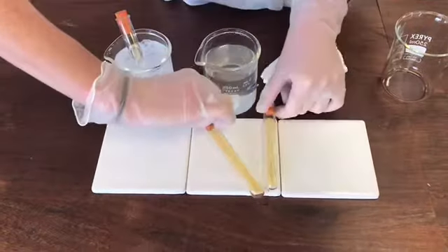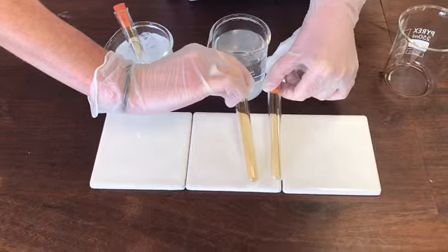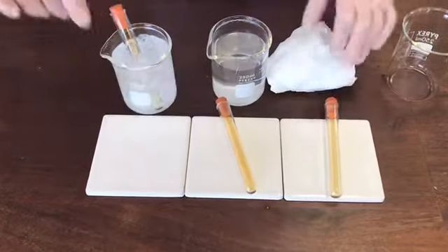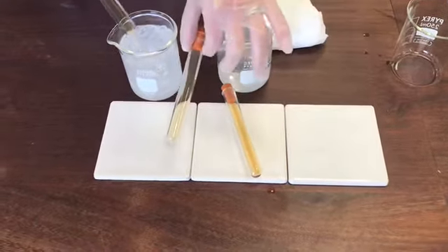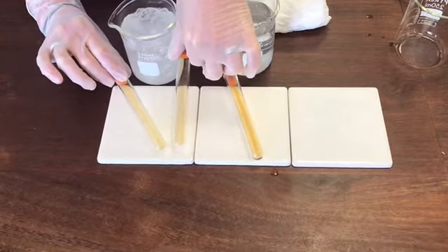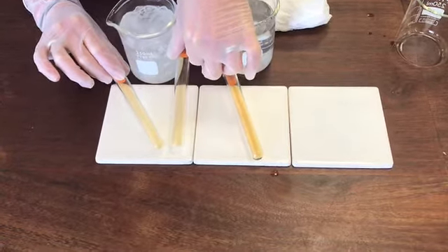And I think you can see that the colour is darker in that tube that's been in the hot water. If I compare it now with the one that's been in the ice bath, so let's take the room temperature one and pop it alongside the ice bath one, I think you can see again that this one's got a slightly lighter colour, the one that's in the ice bath. So it does confirm what I predicted.